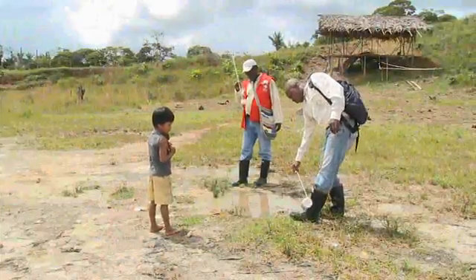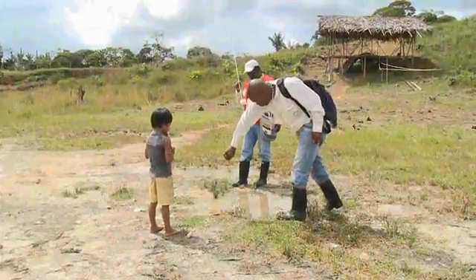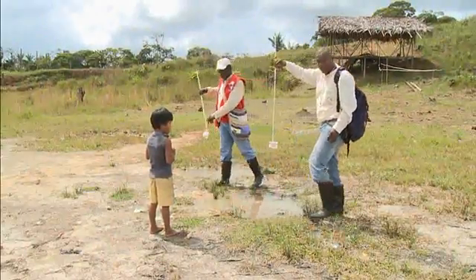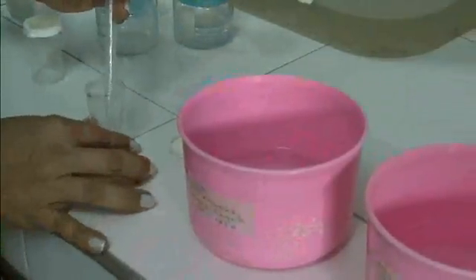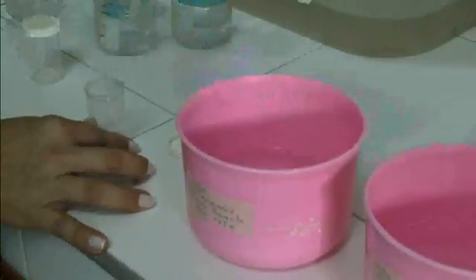This video covers the general techniques used to collect mosquito larvae and pupae. Depending on the vector species being monitored, there might be slight variations in the techniques described in this video.